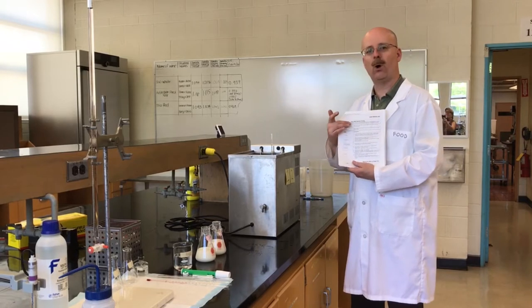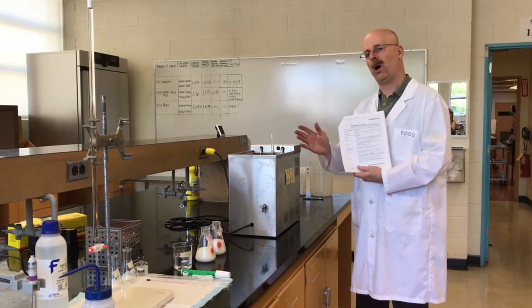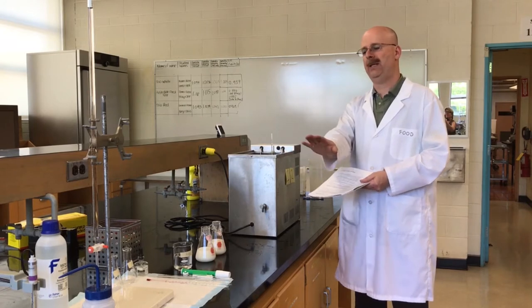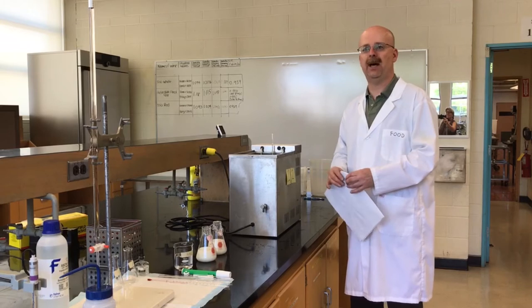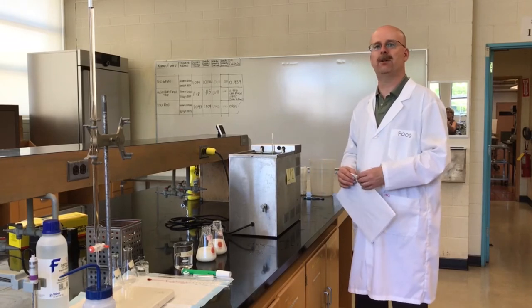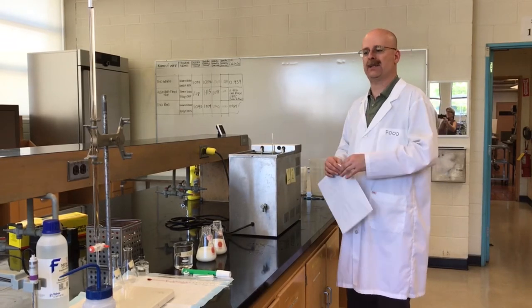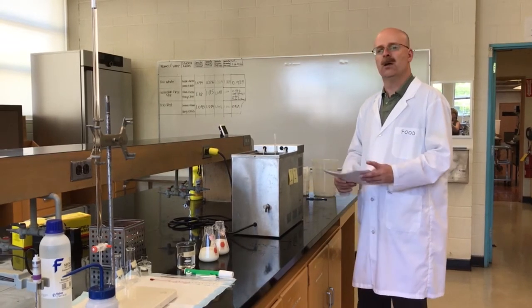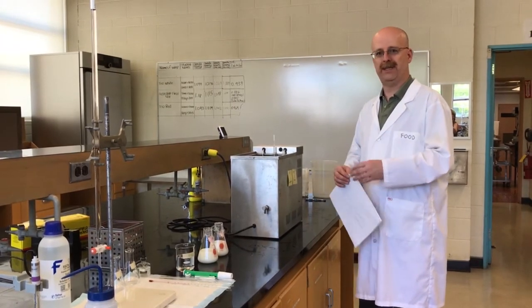This is raw milk quality receiving, so we're going to walk through a number of different tests here looking at aroma, pH, and titratable acidity. These are tests that can be done when the raw milk is received to make sure that it has good quality suitable for further processing.